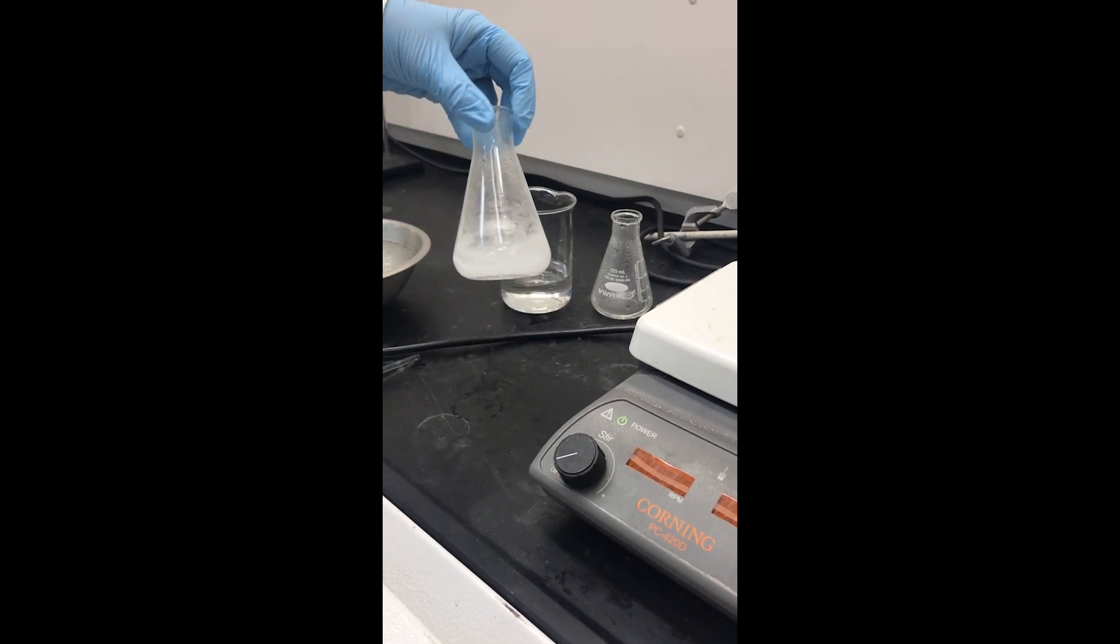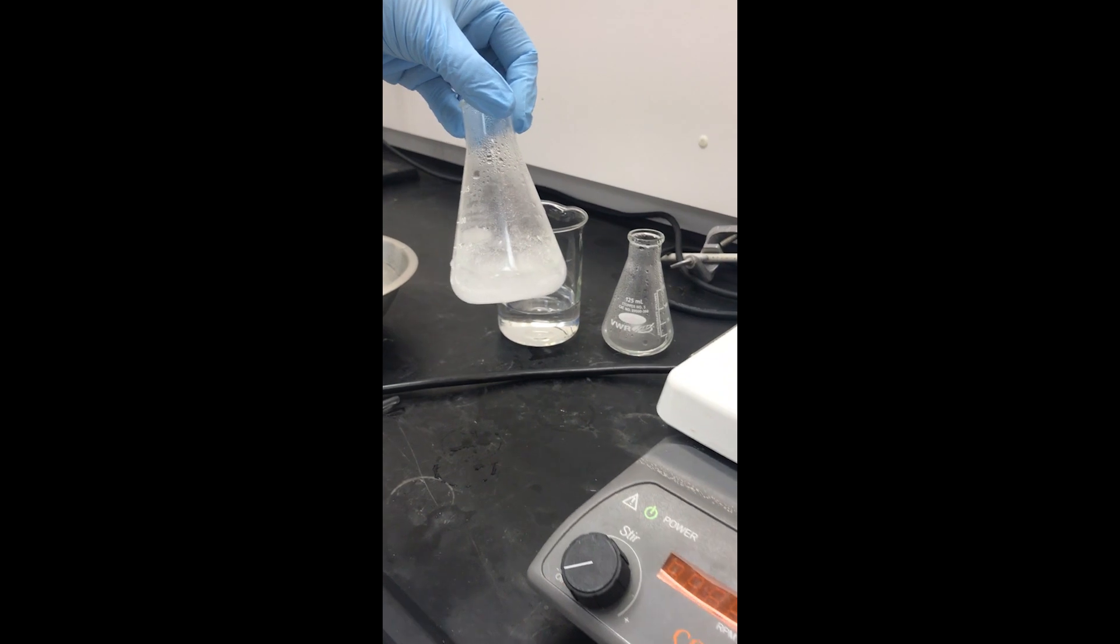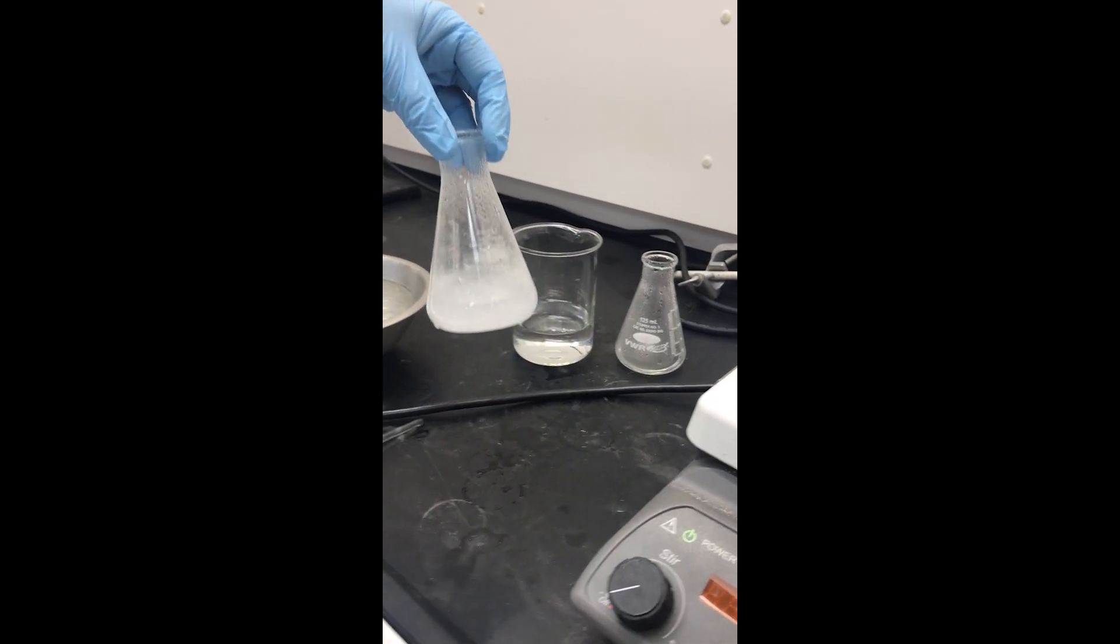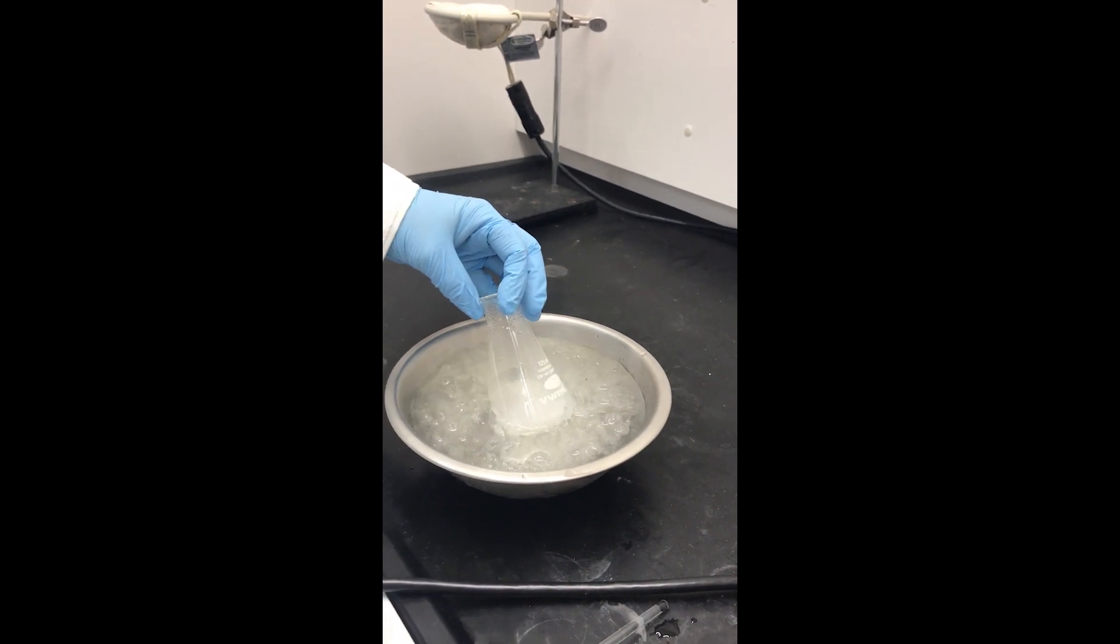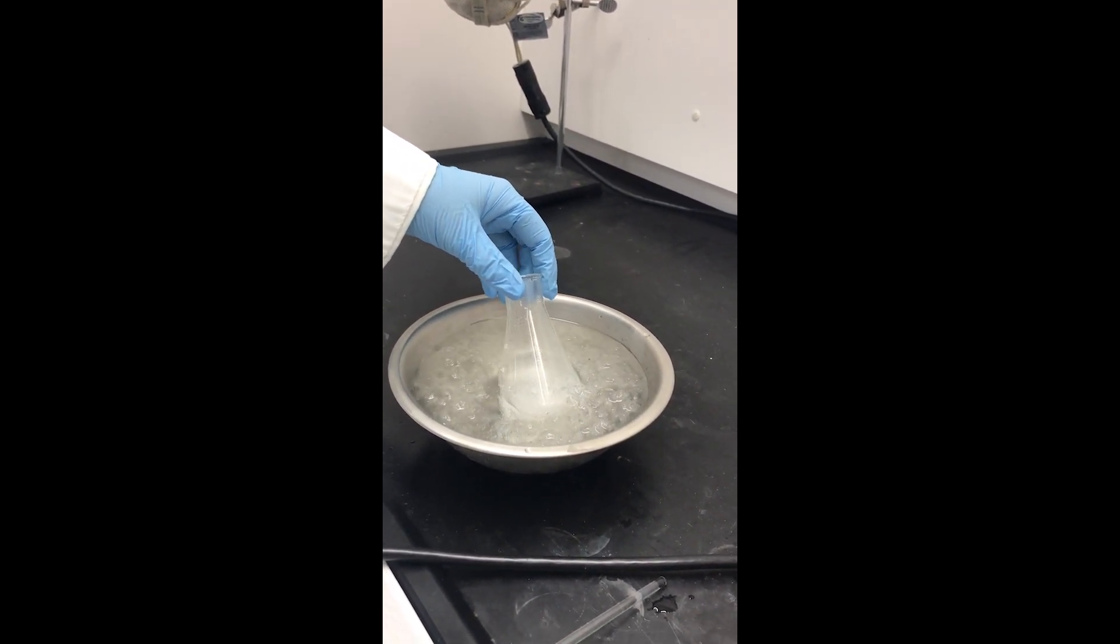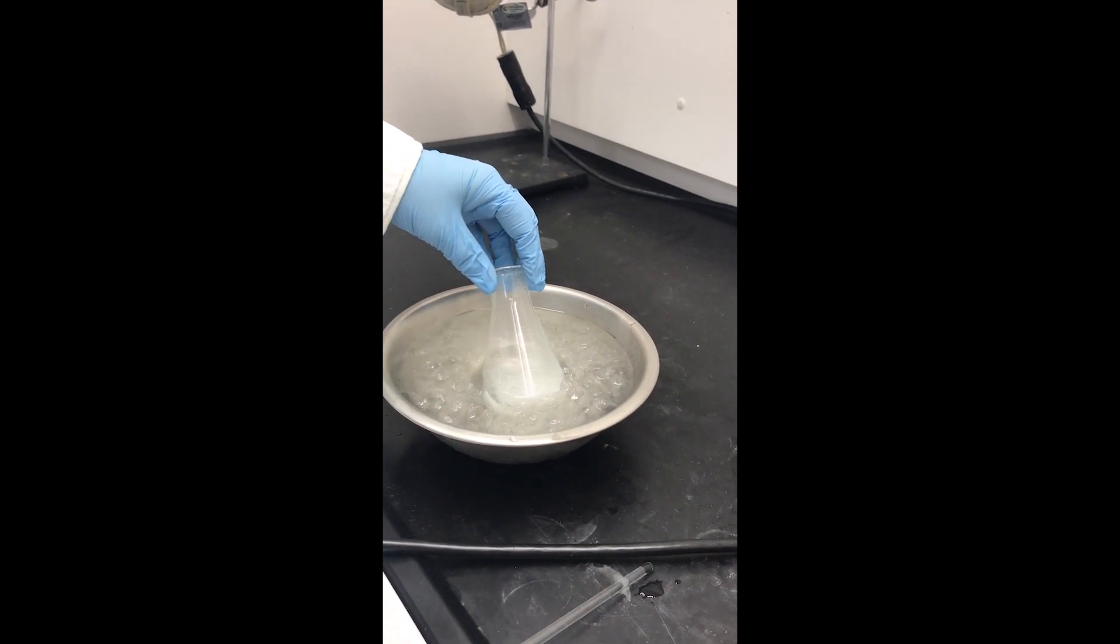You can see that we have a good amount of crystals, but we want to make sure that we maximize the amount of crystals that we can get. So we want to put it in the ice bath for a few minutes. Depending on how much time you have, you could do it anywhere from a couple of minutes all the way up to maybe 15 minutes.